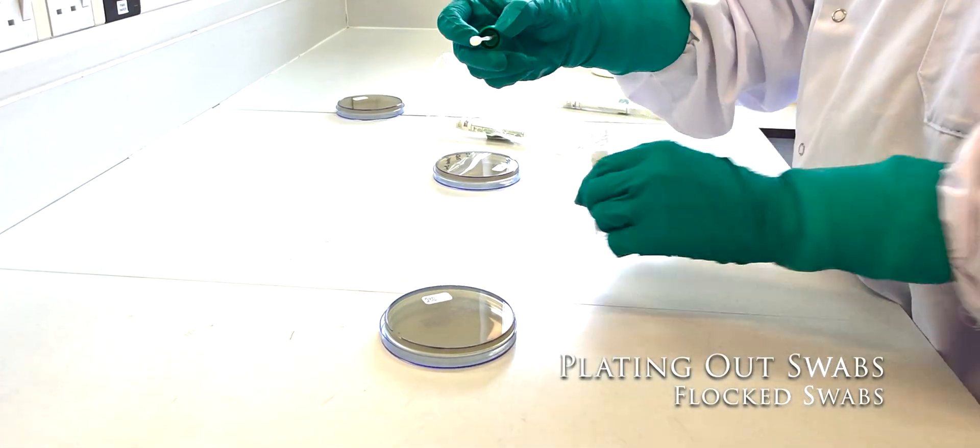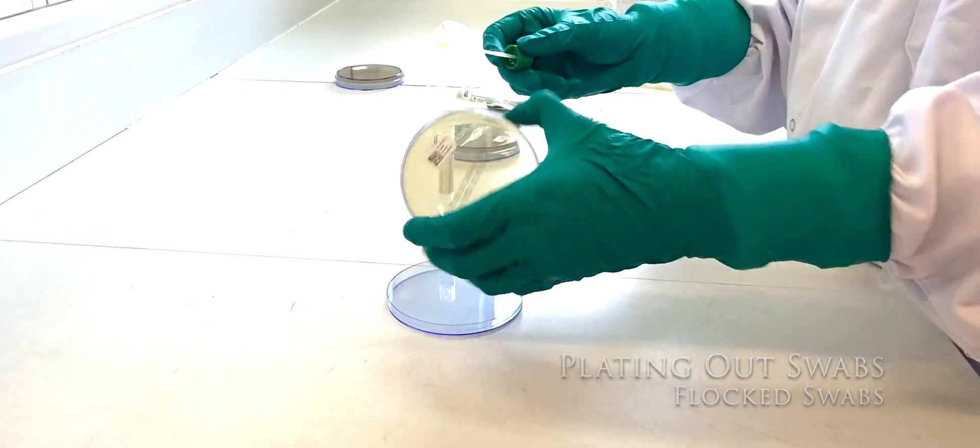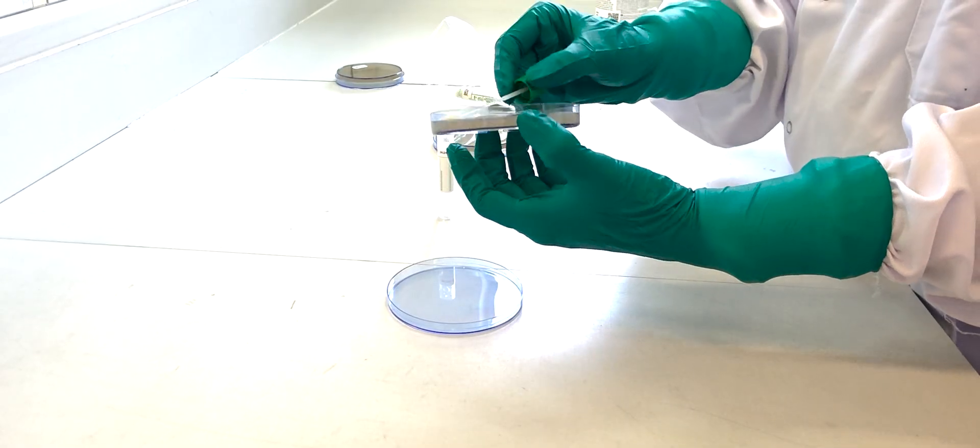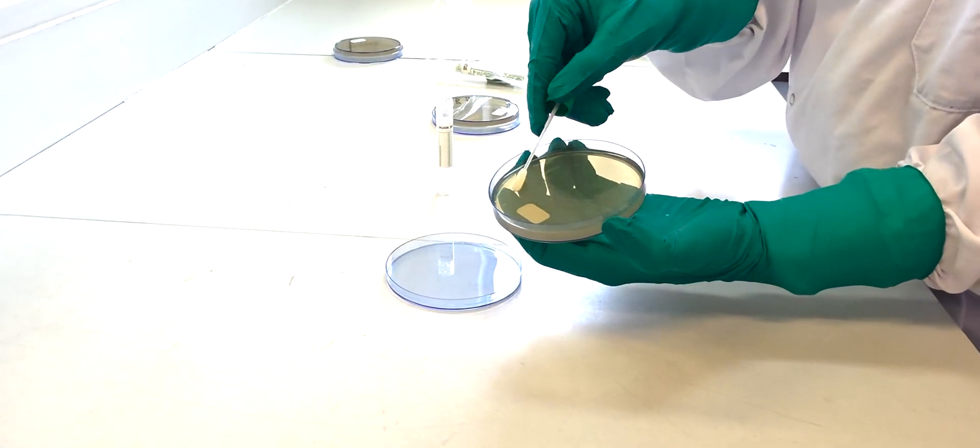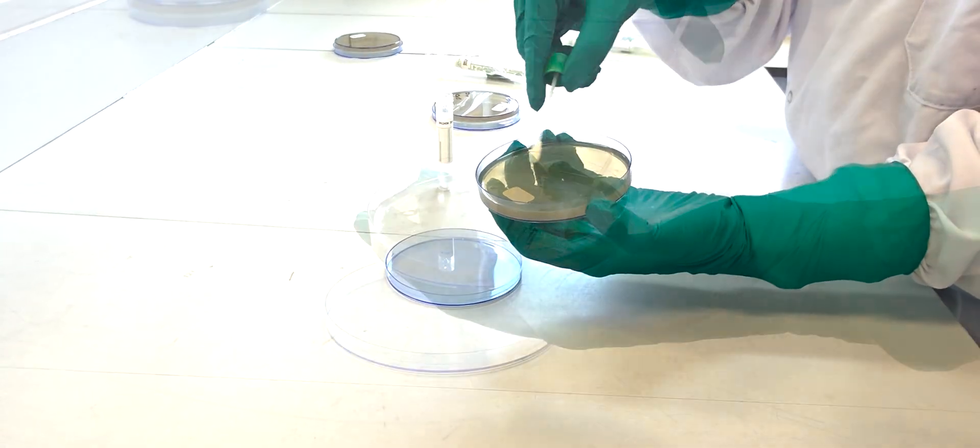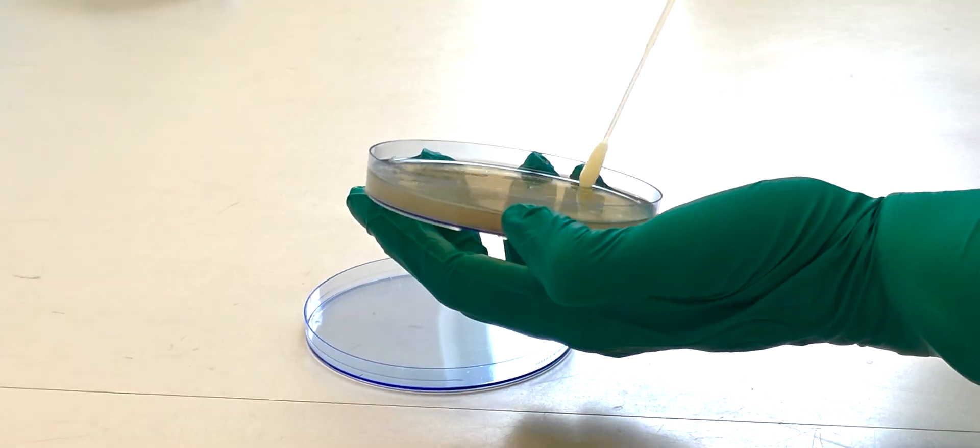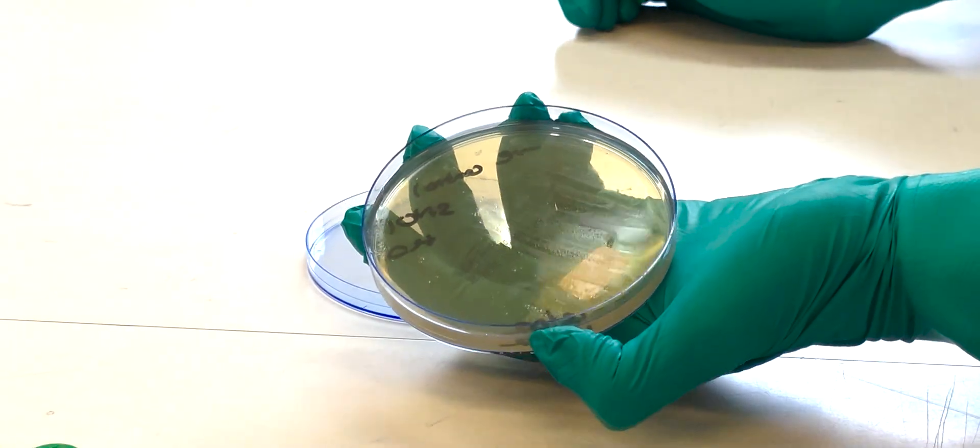Cover as much of the surface of the agar as possible. Plates are inspected for coverage by microstaff. The tip of the swab must also be passed over the agar so that anything on it can be transferred onto the plate.